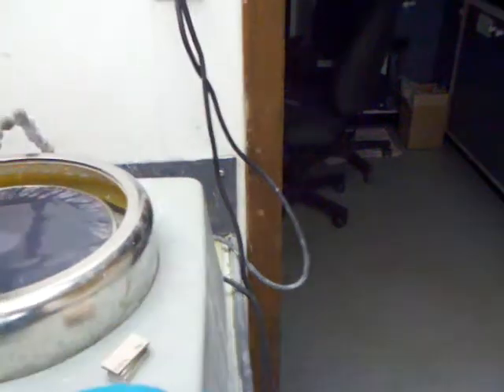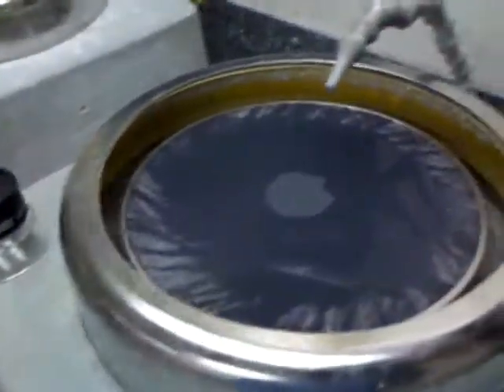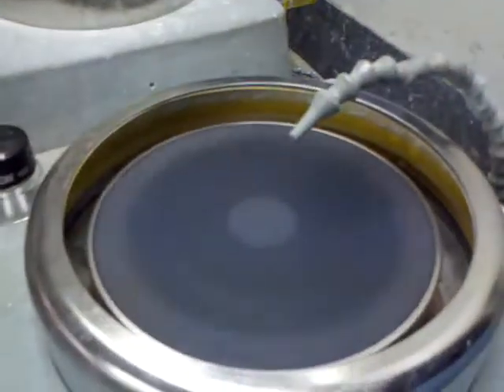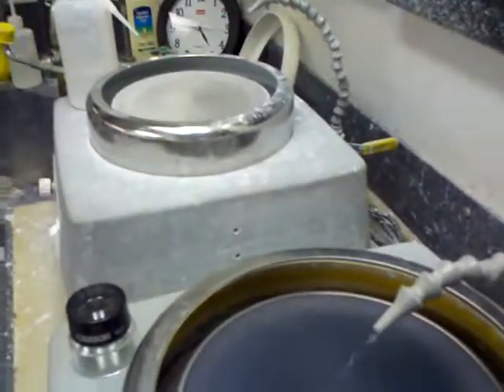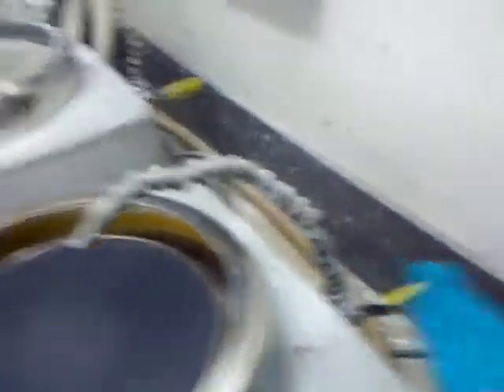I've got some loose ones over here. So this is another area of the lab. You take the smaller section off, and you can see some more contrast in here — those white areas. This is a rougher, more coarse grit right here. I take it and grind it, throw it on. This is a polishing station right here — we've got two of these. That one over there is for the fine polishing. So we do these two steps: sand, sand, sand, and once I've got halfway through, then we take that.